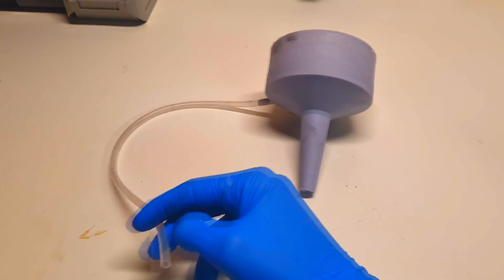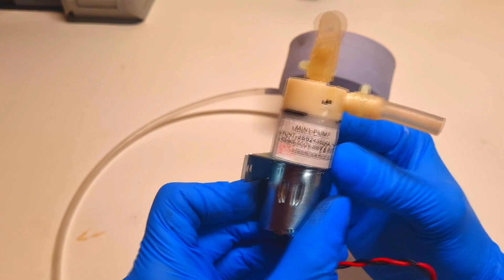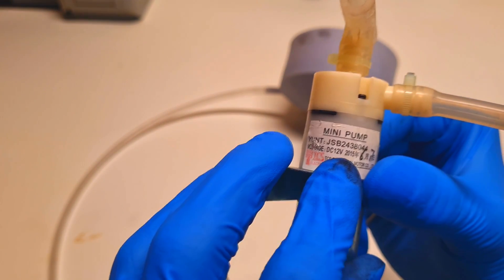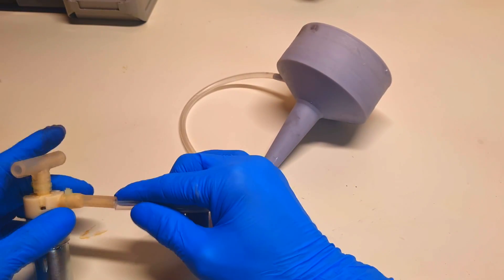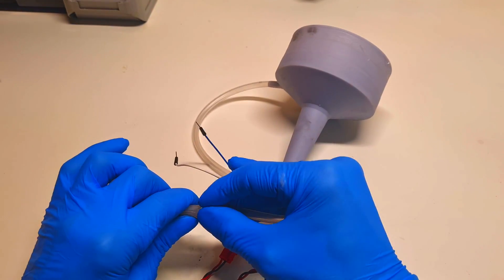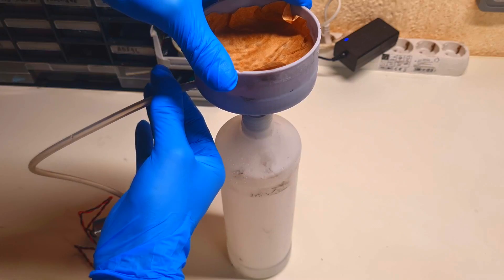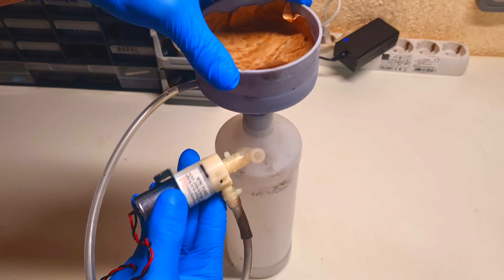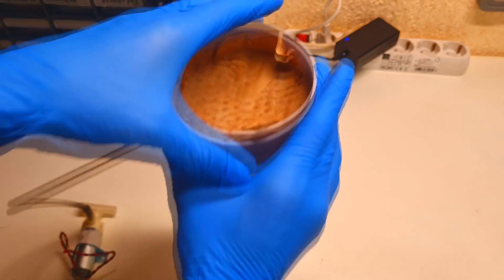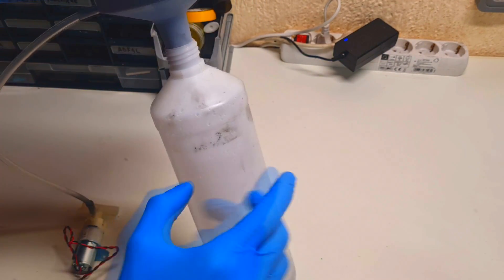To this end I will connect my pump. Here I have a pump I got on eBay — this one is 12 volts. So here I have my vacuum filtration funnel connected with the silicone pipe, and this pipe is connected to my 12-volt pump. Then inside the funnel I put the filter paper, and then I insert this funnel into the container.